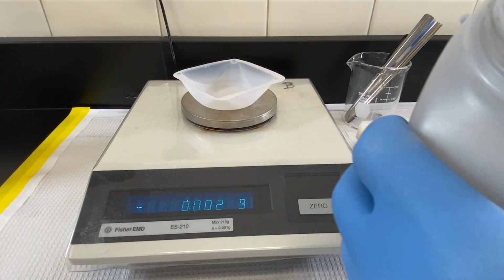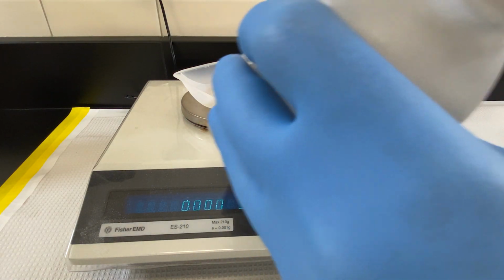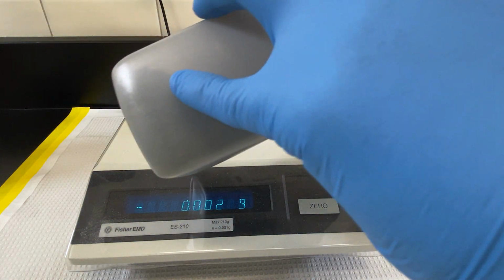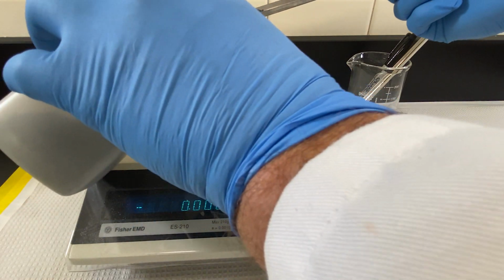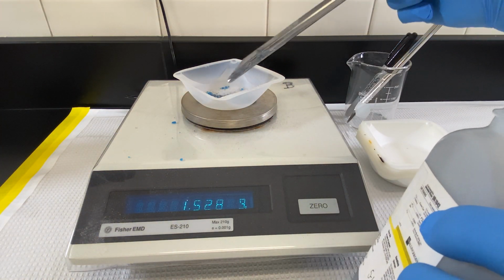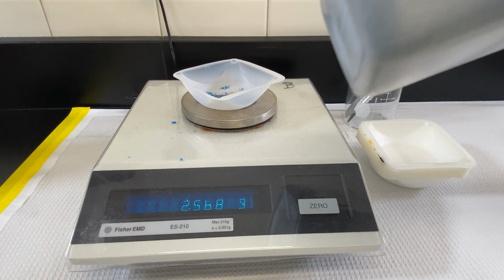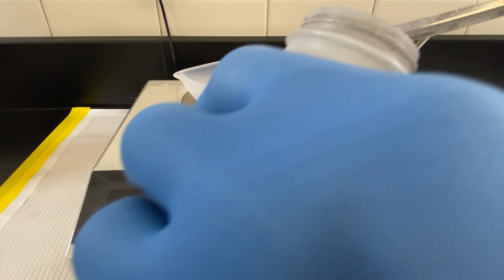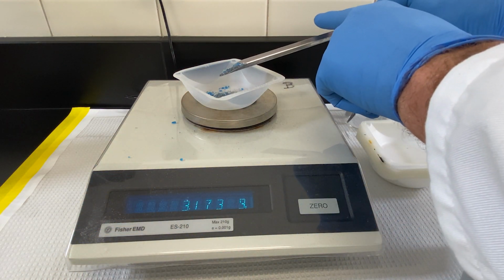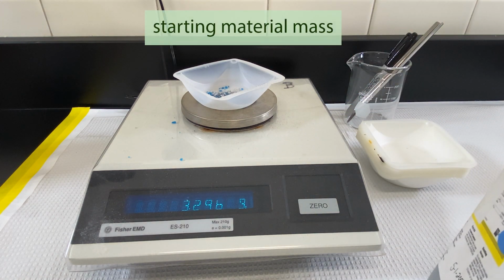We will eventually determine percent yield, and to make that determination, we will need to know how much material we started with. There, that should do it.